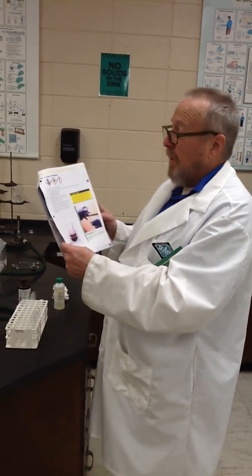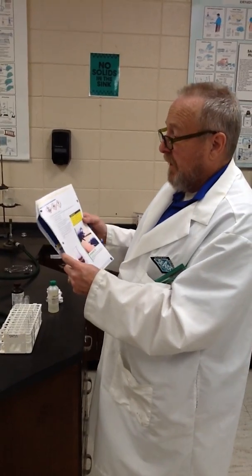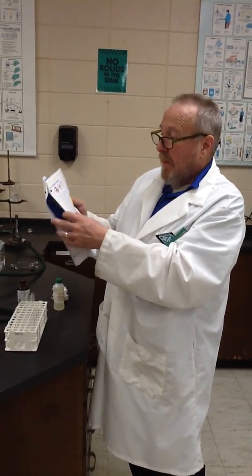In Part C, this is Lab 4, we're examining the reaction of the group 7 halogens. It's titled Halogen Ion Reactions, and the instructions 1 through 5 read as follows. So I'll read them and then we'll do them.